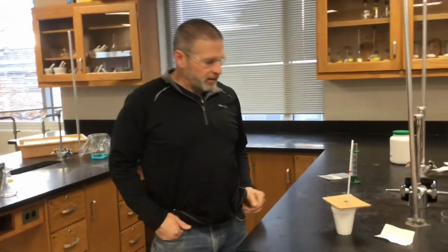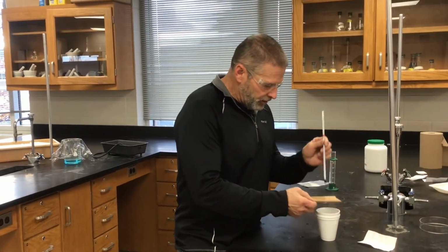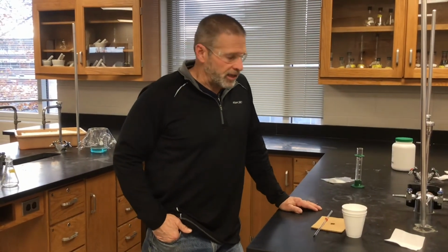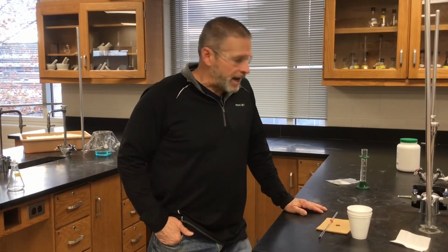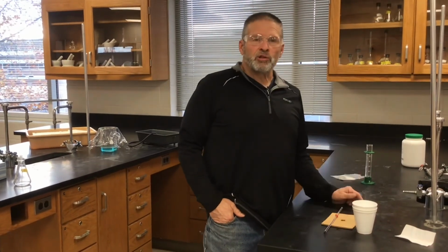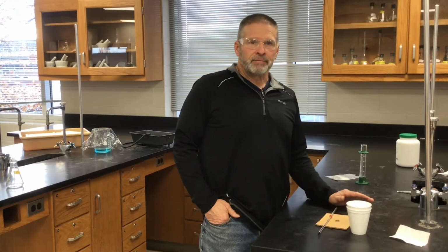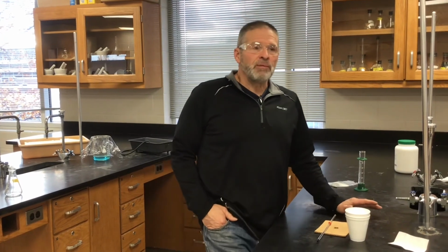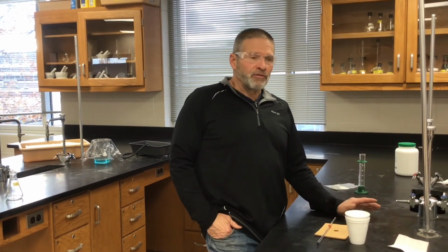Now, one final thing, because it's confusing every year doing this lab. You have to use the Q equals MC delta T equation to calculate heat. And so you need to plug in a mass. We realize that the HCl solution we're using is almost entirely water. There's a little bit of HCl, but it's almost all water. So pretend it was 50 milliliters of water and convert that into grams. Use that as the mass in the Q equals MC delta T equation. Good reminder. So we're now going to try to find the experimental heat of formation of magnesium oxide. Good luck. Good luck.